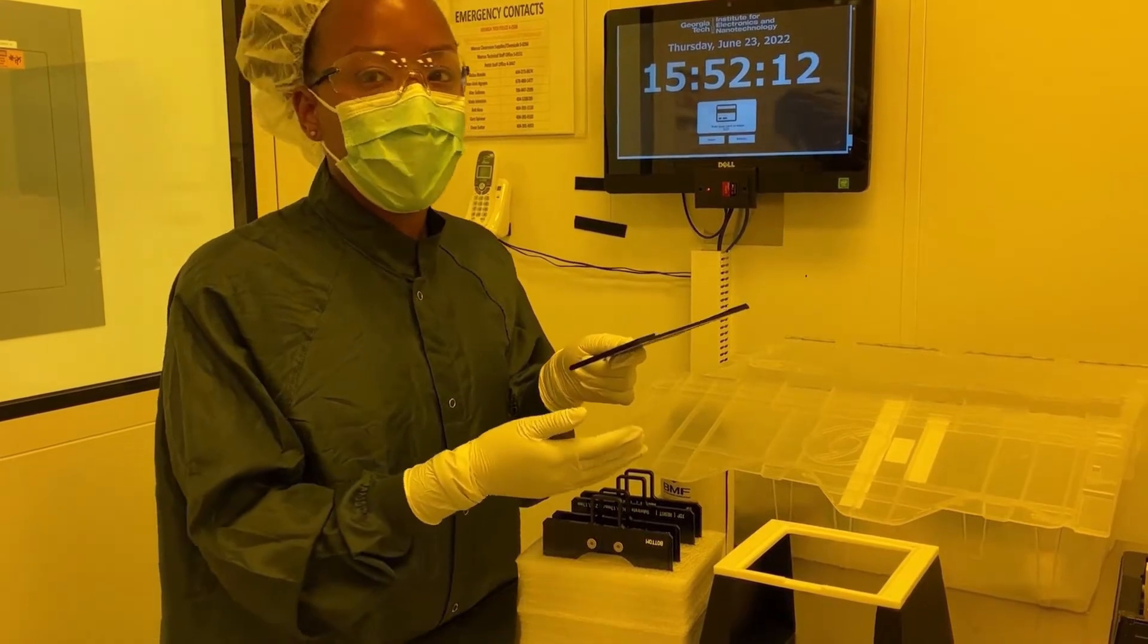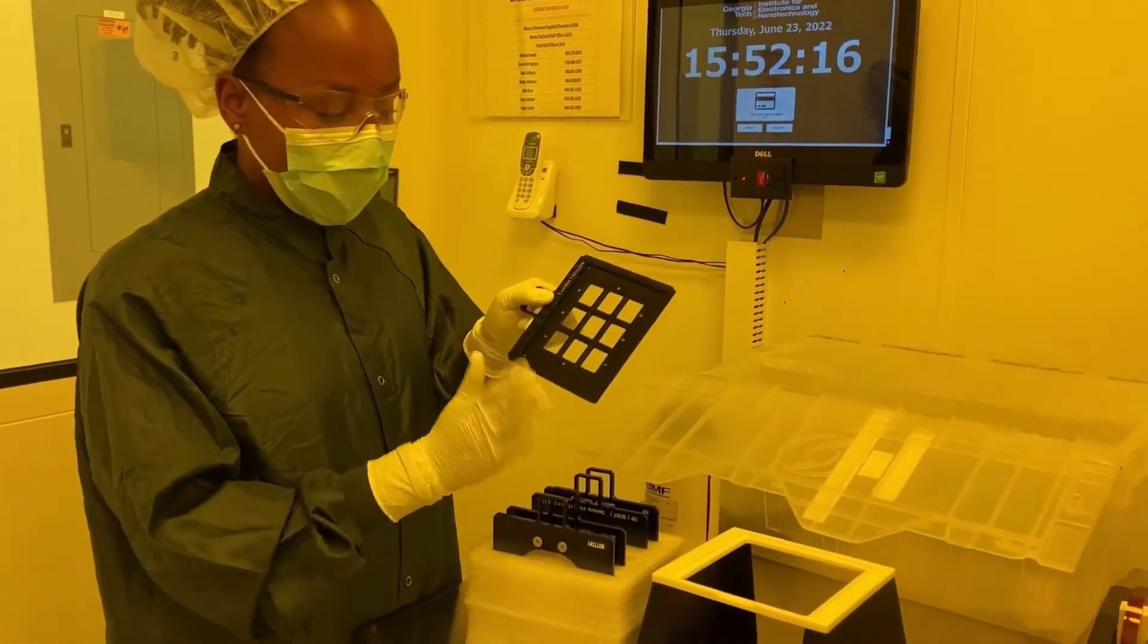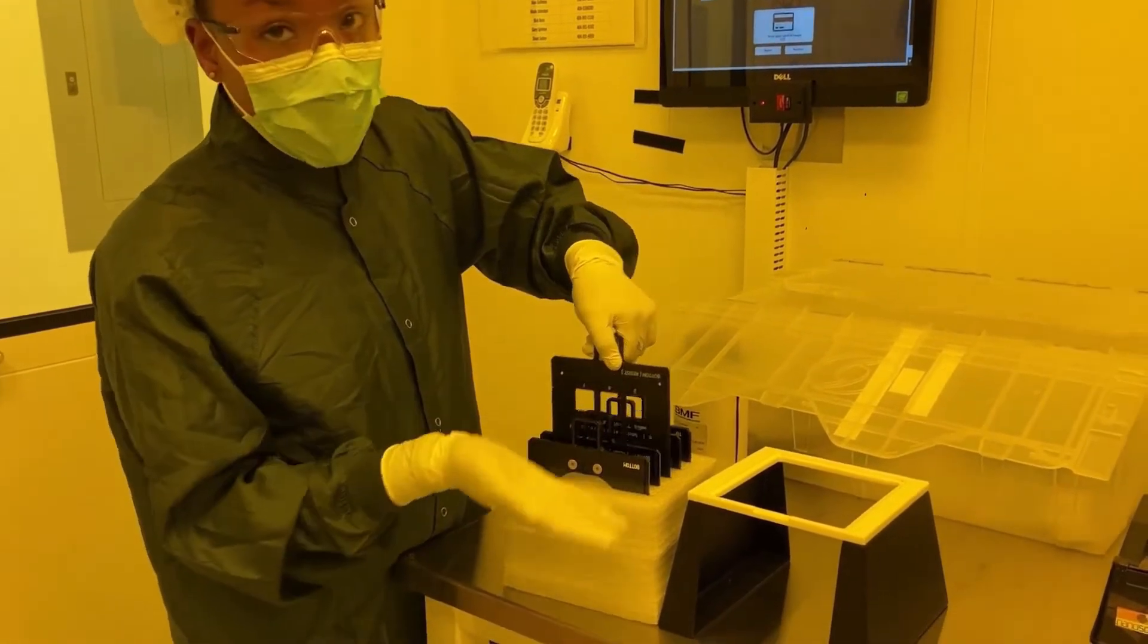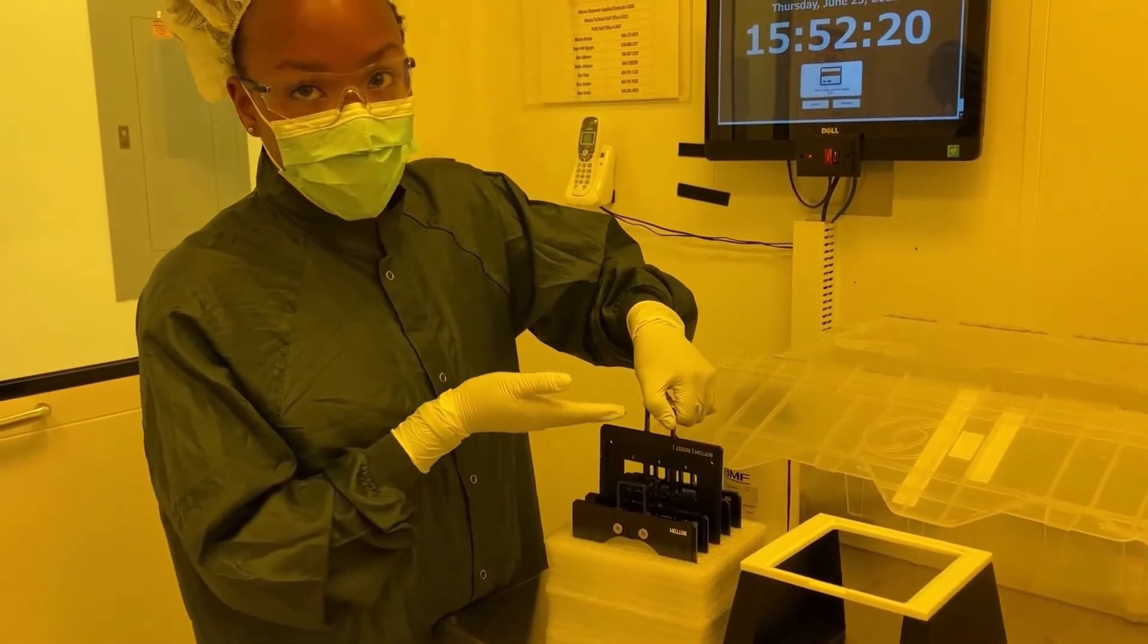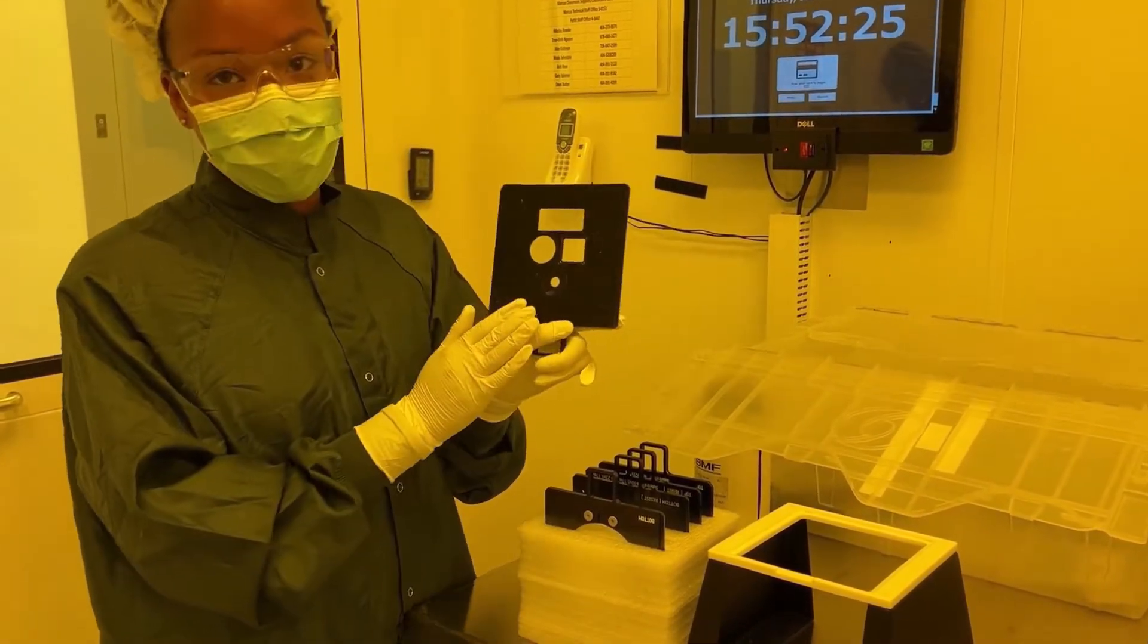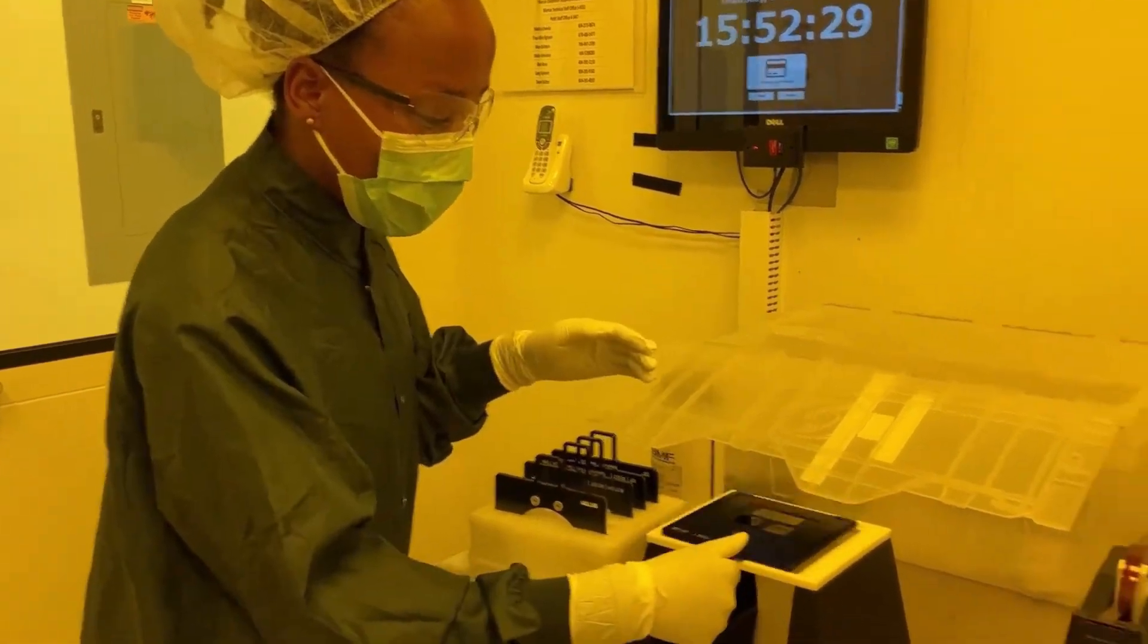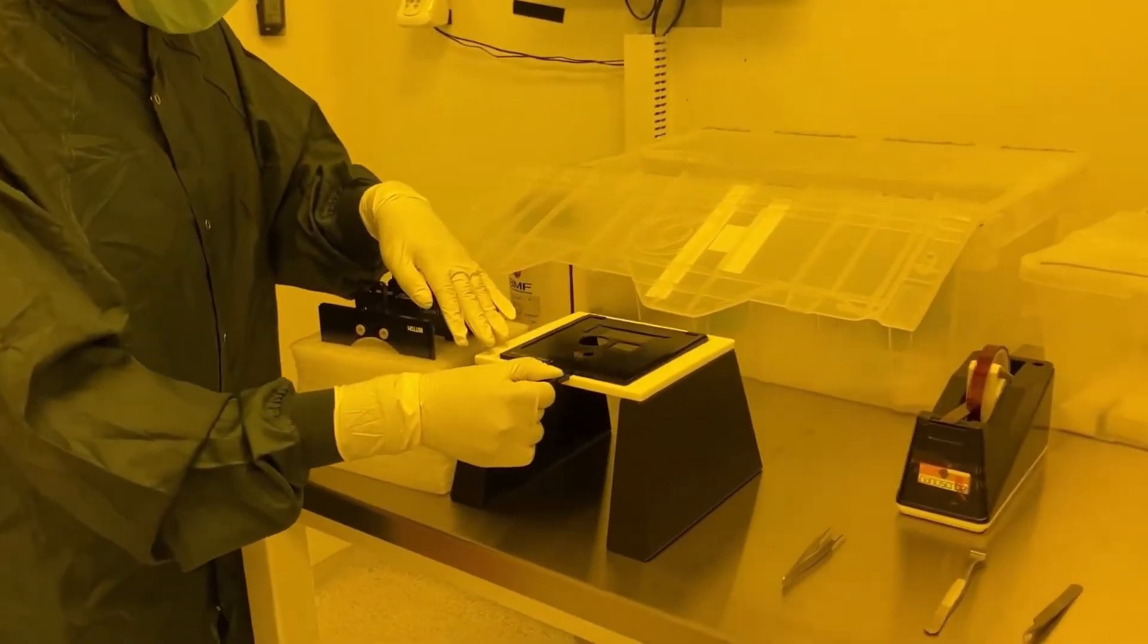The third one is just for regular 1-inch slides; they can also be used for batch work. This fourth one is what will be used for this demonstration, and it is very commonly used. When you have your desired holder, you place it bottom side up on the elevated plate.